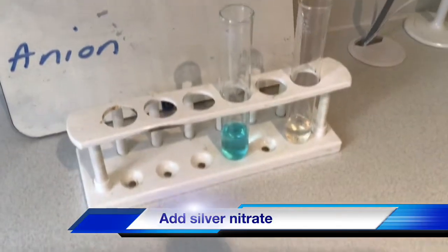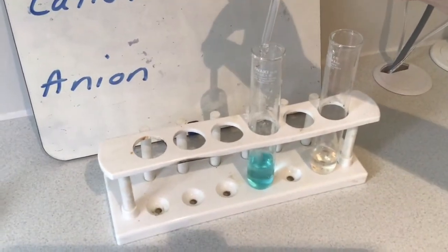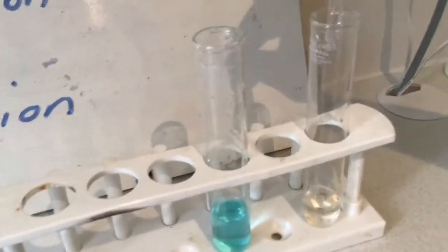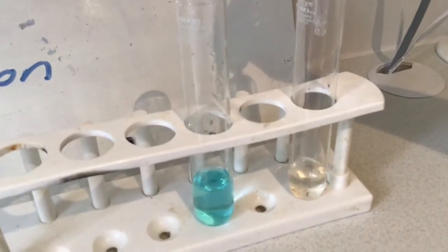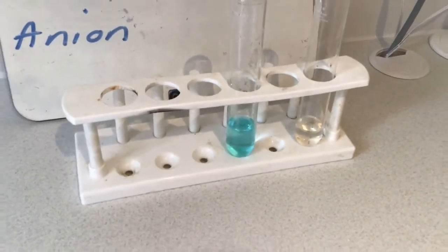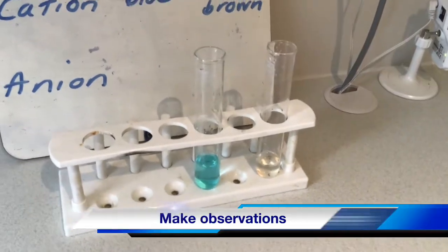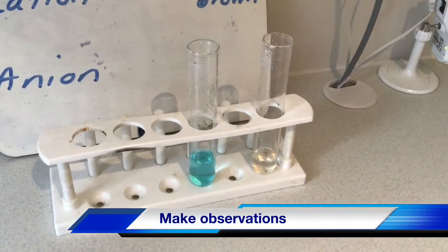So we're going to add a few drops of silver nitrate to both of those boiling tubes and see if any precipitates formed. Just a few drops. Okay, and to the other one. All right, so this time we've got nothing happening. Okay, so no precipitate.